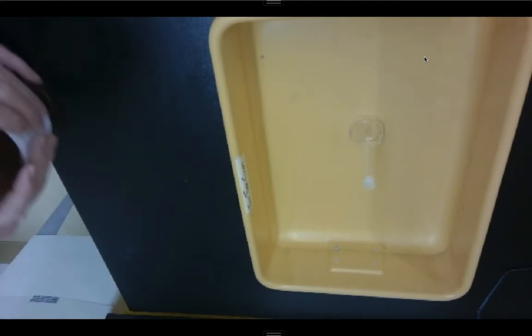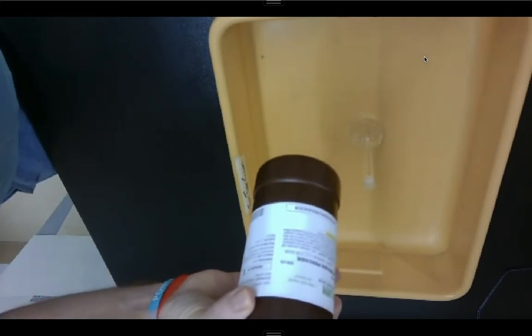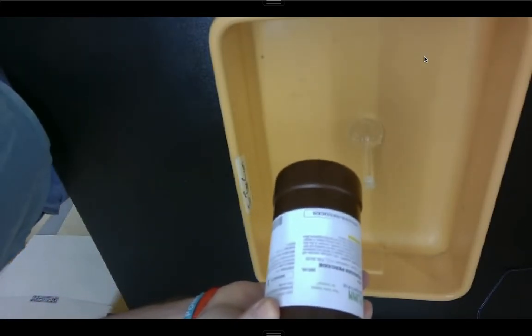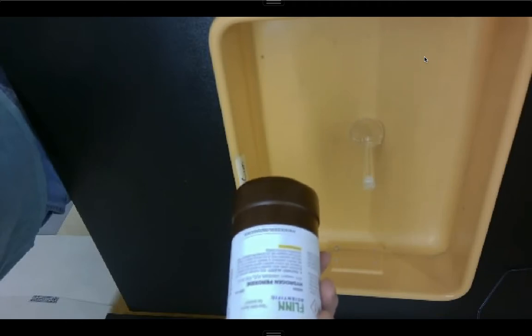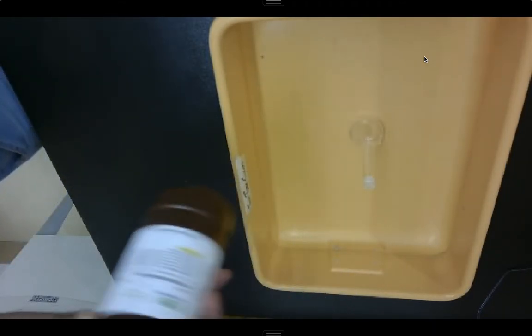So today we are going to be doing a little decomposition of hydrogen peroxide. Hydrogen peroxide is something that you might have in your household medicine cabinet, where this is a much more concentrated version. This is going to be 10 times more concentrated than, in all likelihood, what you have in your medicine cabinet. And we're also going to show the effects today of a catalyst.